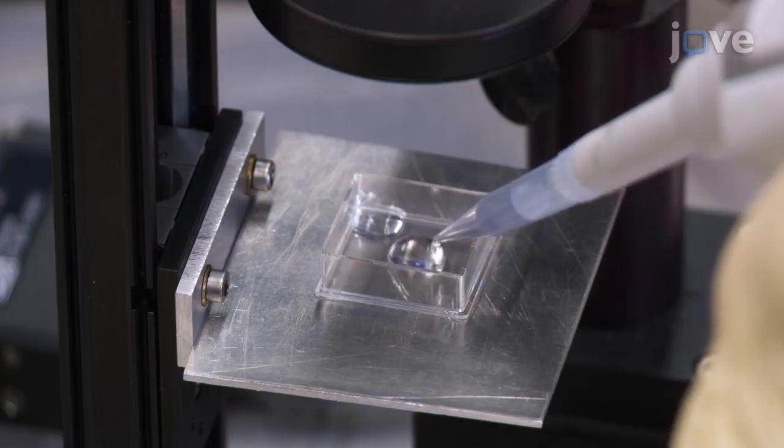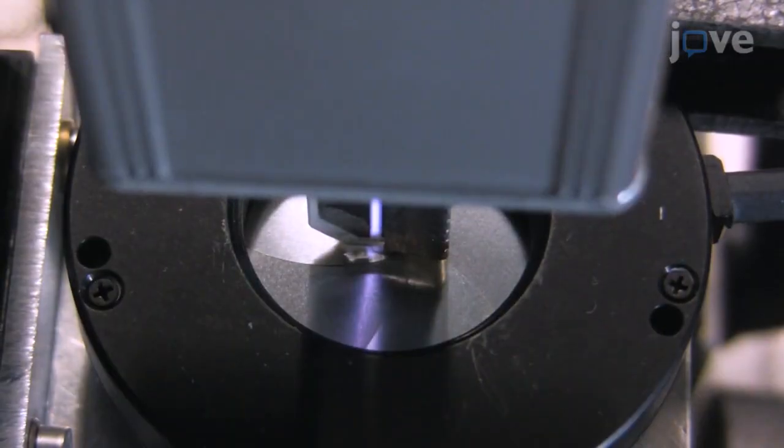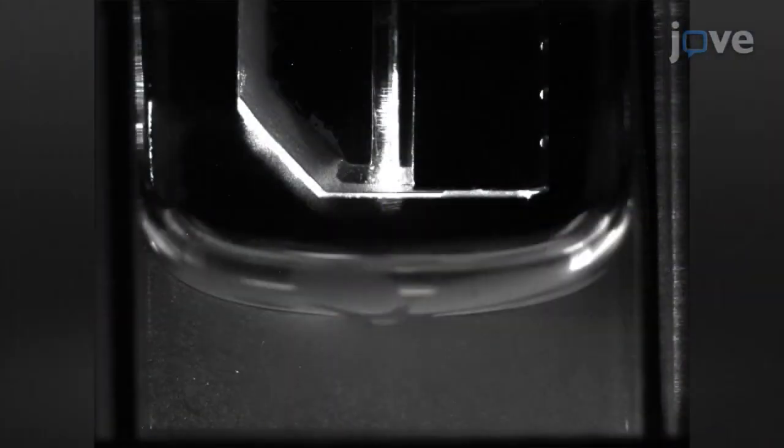By following the steps in this protocol, any scientist should be able to set up the COST jet, measure the applied power, and apply the atmospheric pressure plasma generated in the device on a solid or liquid substrate in a reproducible manner. Applying the COST jets onto samples, such as biological substrates, allows direct comparison between research results of different groups, as well as direct comparison between simulation and experiment.